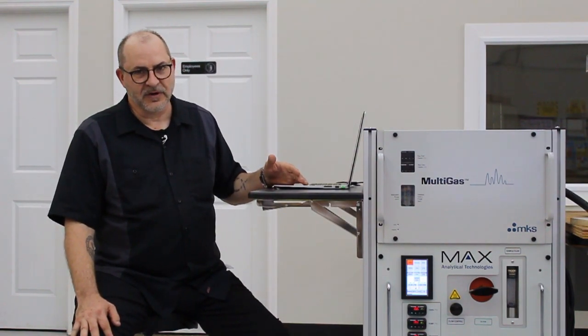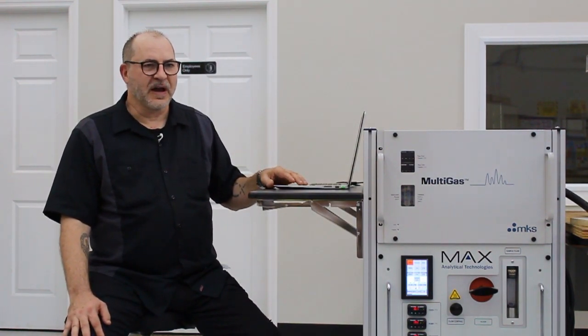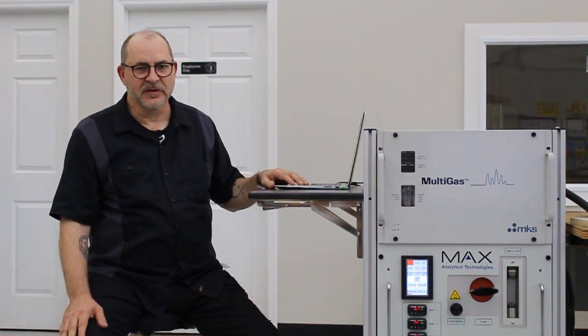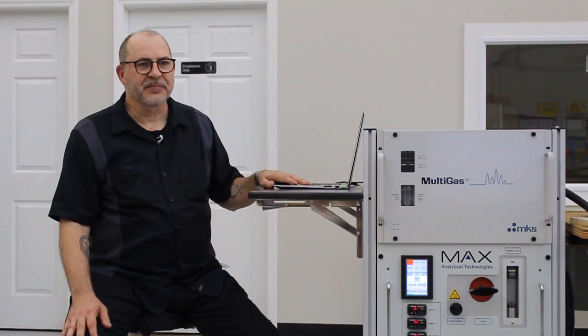So you're replacing conceptually 10% of the sample volume with a spiking standard, ideally of higher concentration. So if there's 5 liters per minute sample flow through your entire system, you're adding 0.5 liters per minute of your spiking standard. And that yields a weighted average concentration that's greater than the native.